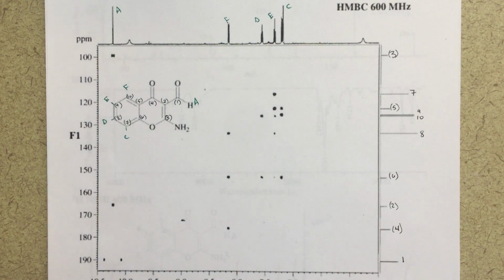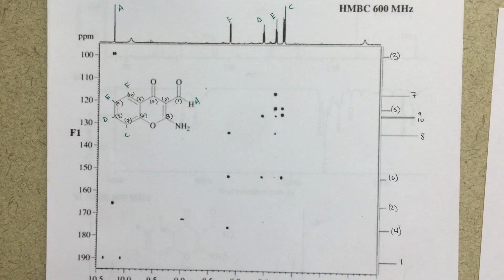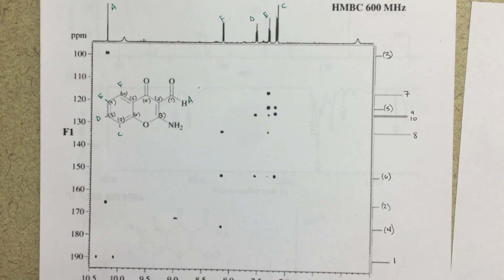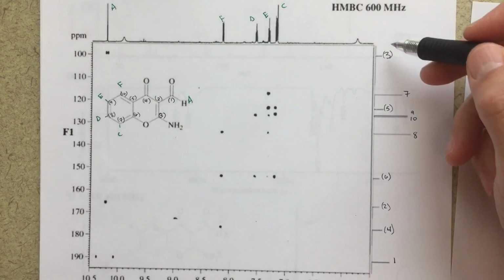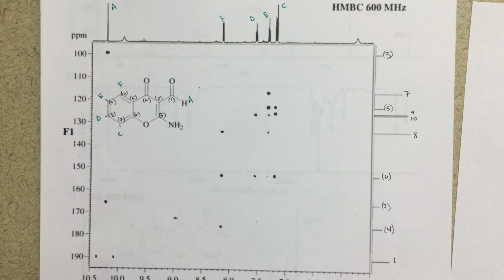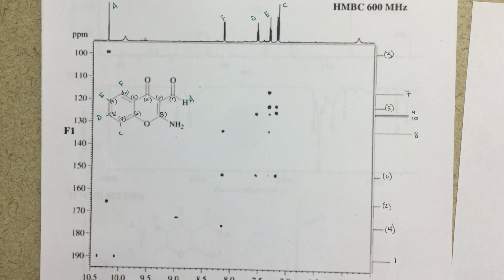We can go ahead and start filling in our diagram from before. So starting at the bottom, I've got 3. So I'll fill them out, and then I'll show everyone where we're at with our assignments. But this should be all of our 1, 2, 3, 4, all the way to 10, all of our assignments for our carbon NMRs. We obviously talked about our assignments for our proton NMRs already. So 167 is 2, and then 176 is 4.